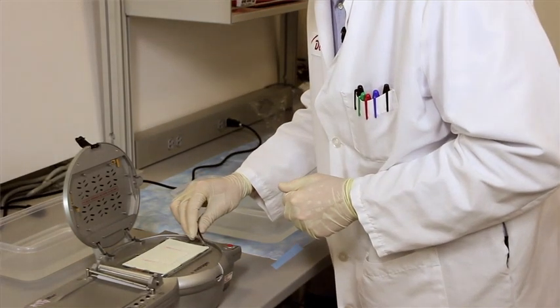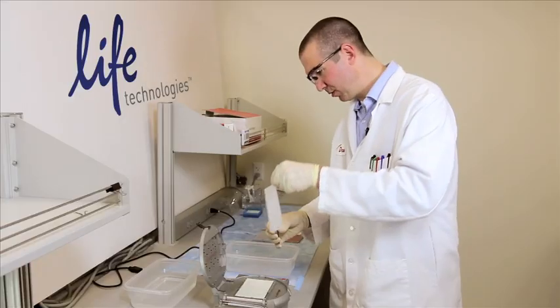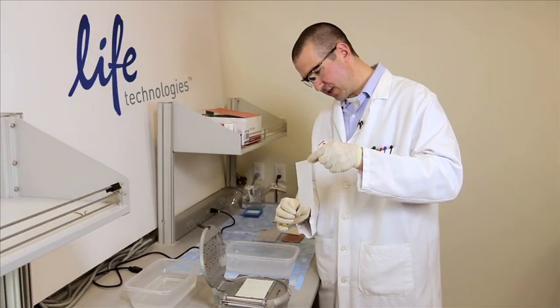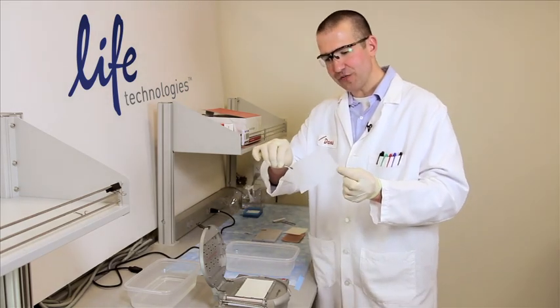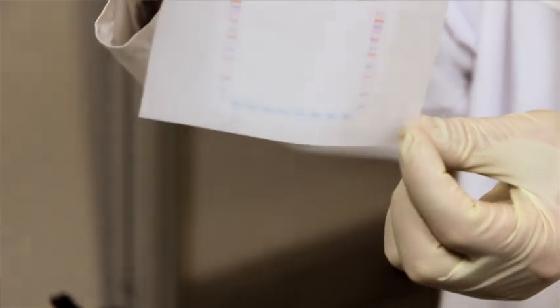And here is our PVDF membrane and behold our proteins of interest, or at least we can say for now the dye fronts transferred as well as the Sharp pre-stain standards.